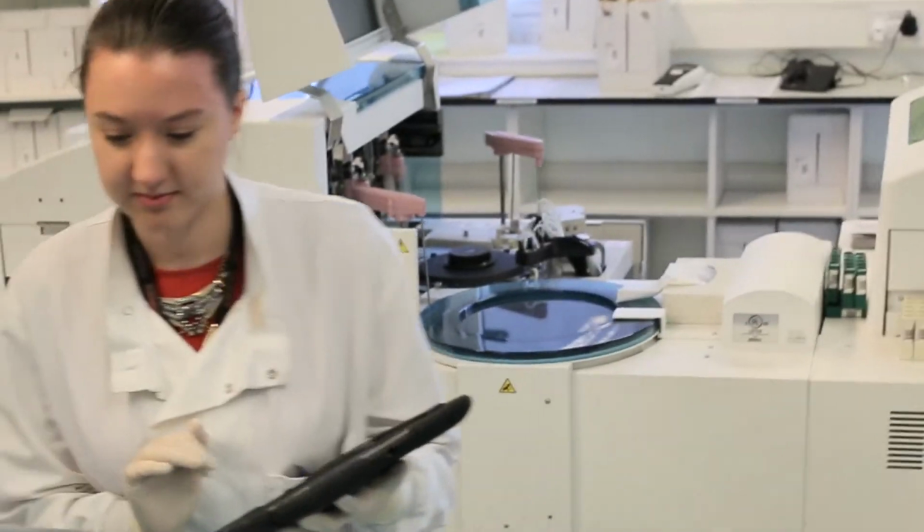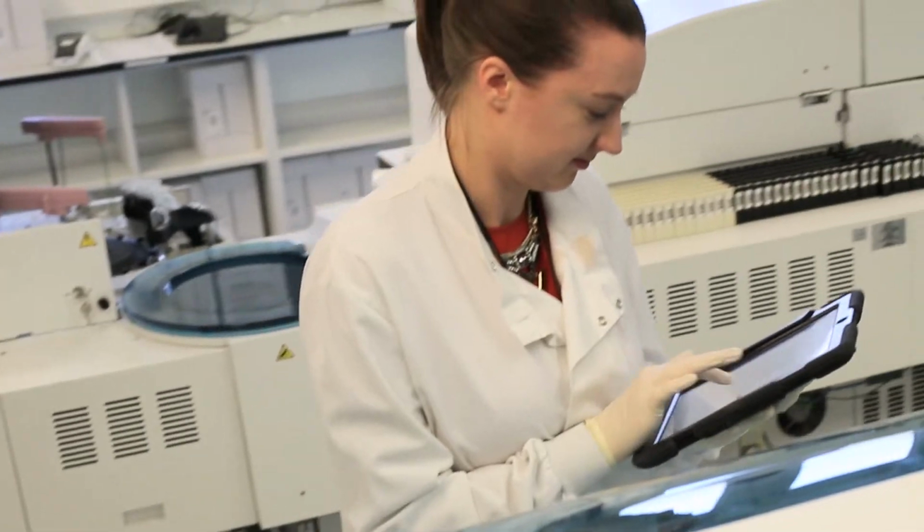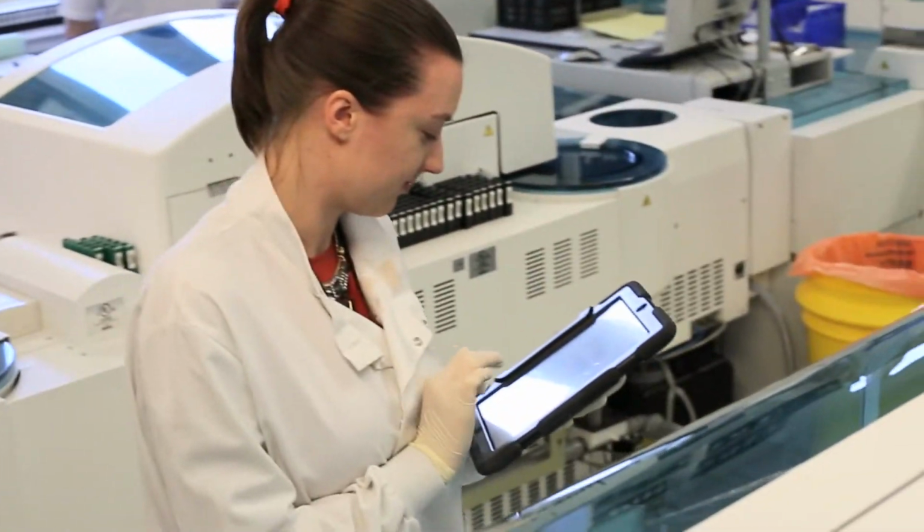We use both the Q-Pulse apps for documents and audit. They are the modules that we use most commonly in the department, and it's great being able to have them on the go, on the move. So the Documents app is used so that people can access documents, policies, procedures without having to be right beside a PC, especially in the blood sciences department where there's big analysers. It's great to be able to have your policies wherever you require them.